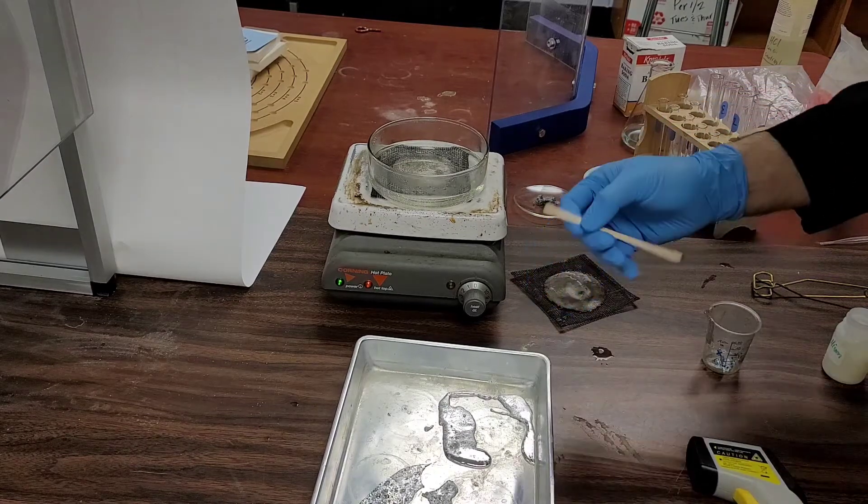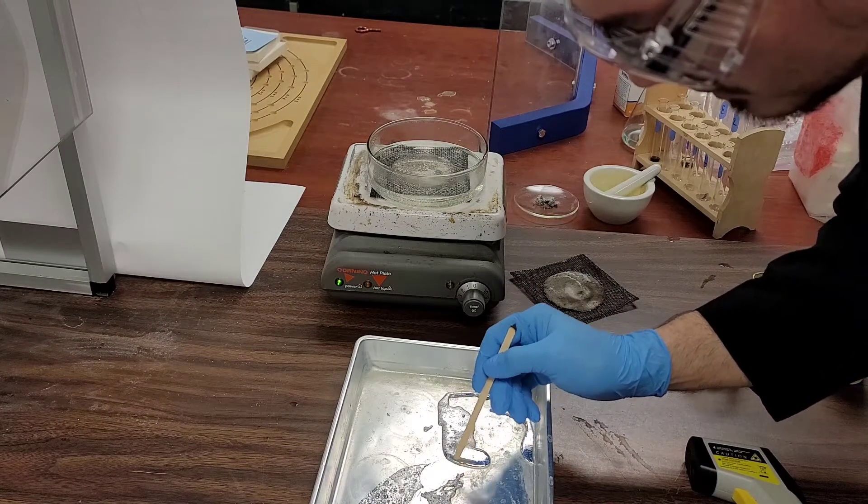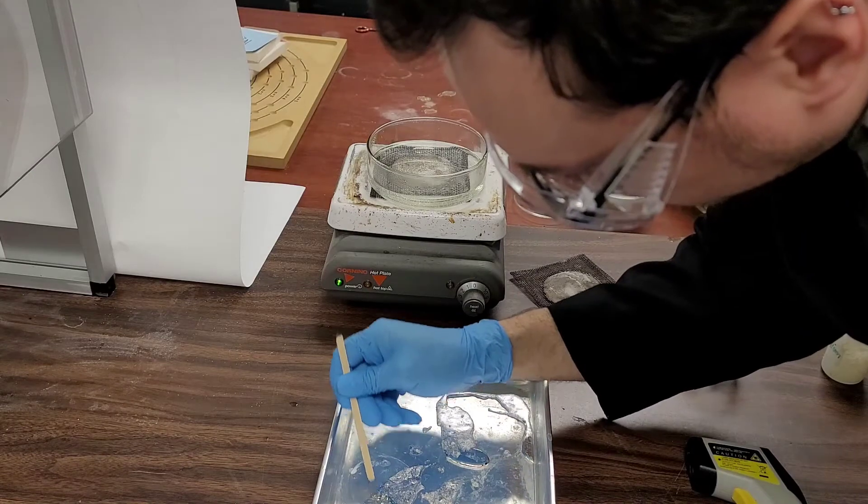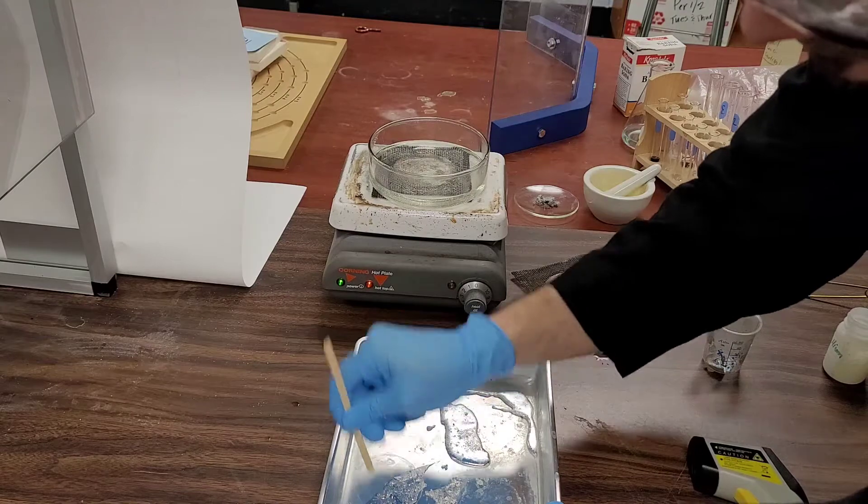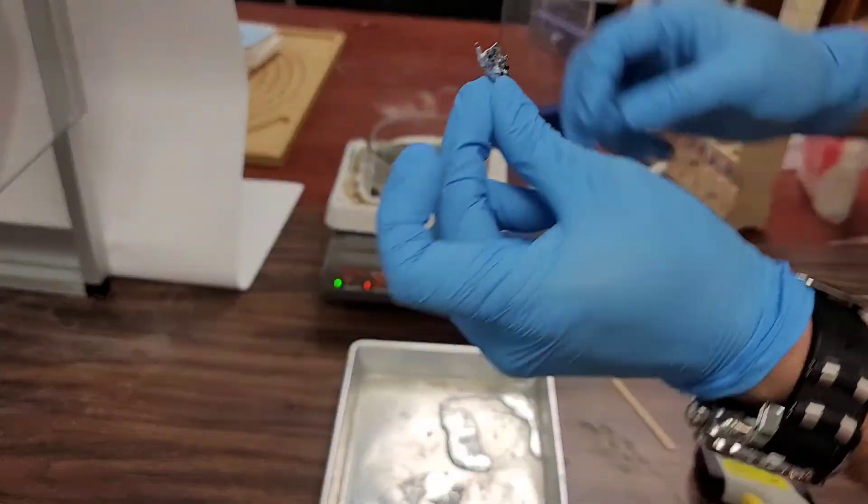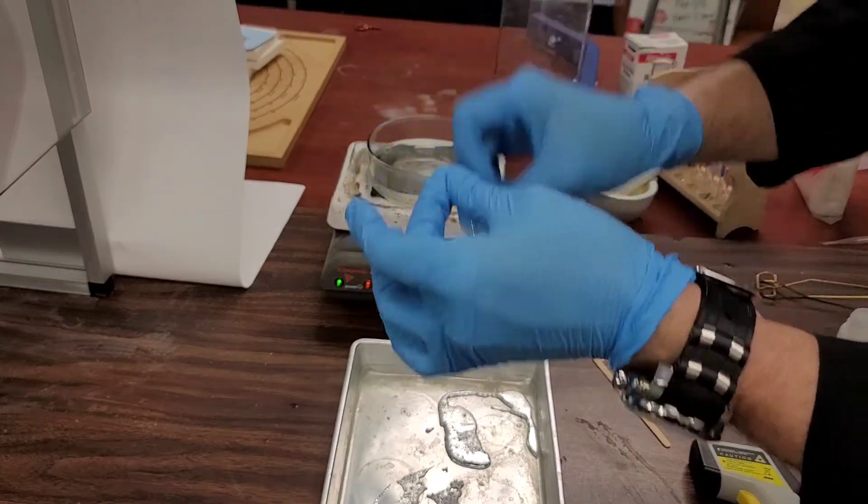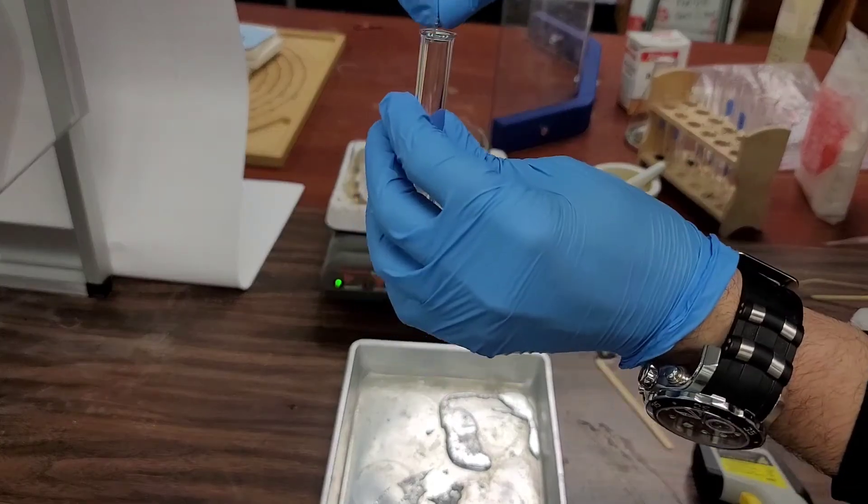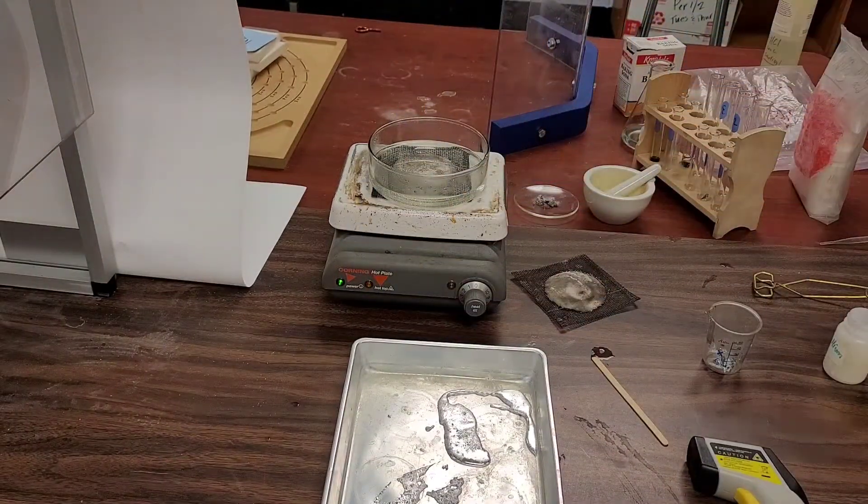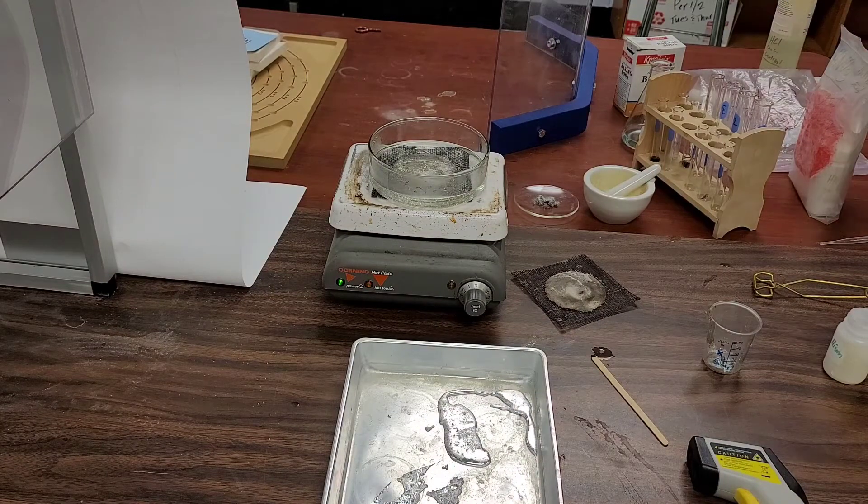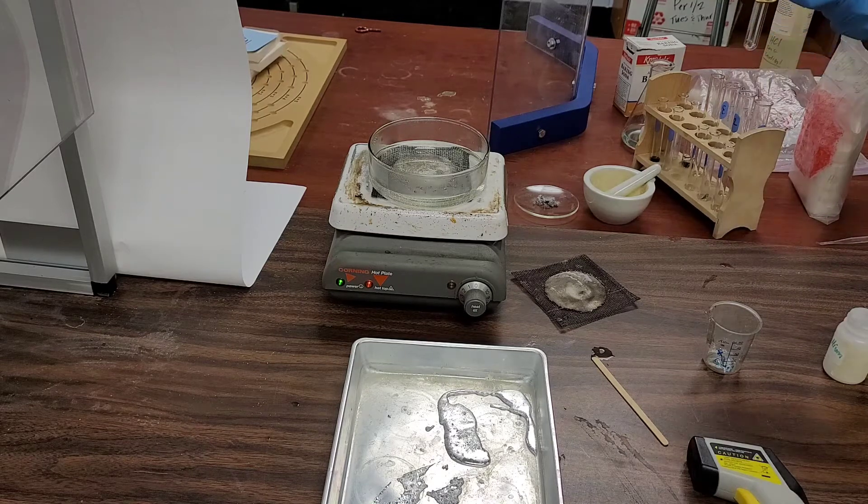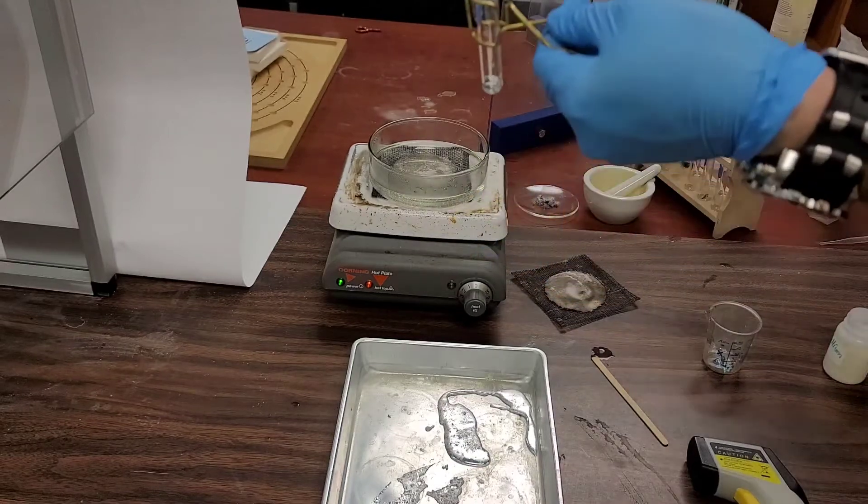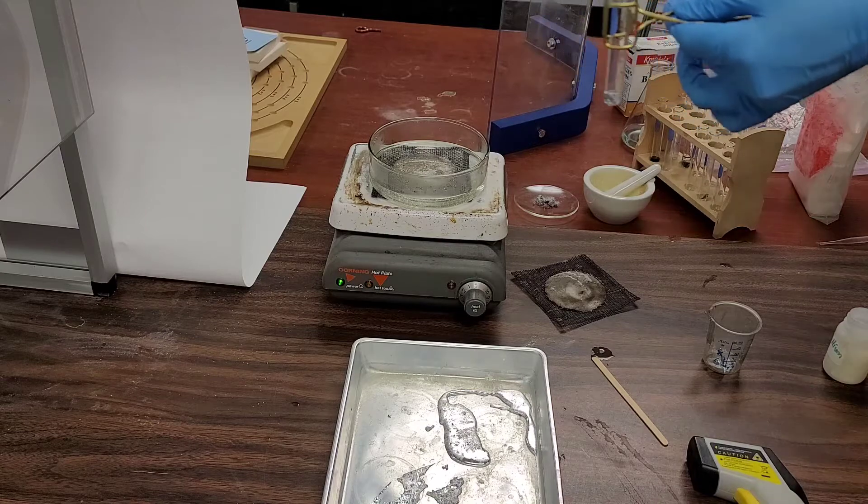Let's see if I get a small sample of the gallium and try to react it with hydrochloric acid. I'm not sure if I've ever tried this, so I'm curious to see what happens if I do get a tiny bit. Can I get a little bit of the gallium? Oh, here some of it froze, get a crystal of it. There we go, see some solid gallium flakes there. All right, let's put that in a tube of testing. And let me get some more hydrochloric acid. And let's see if anything happens. Okay. Gallium with hydrochloric acid, let's see.